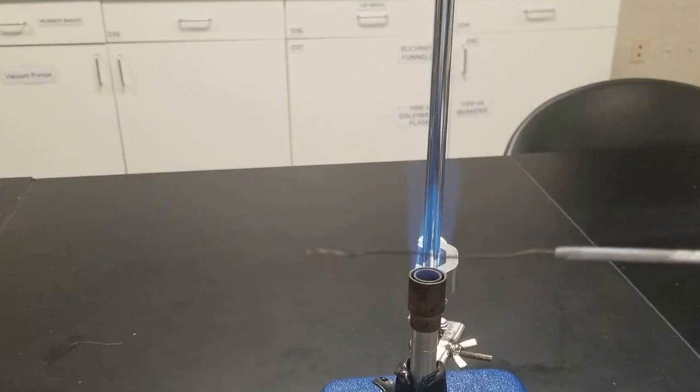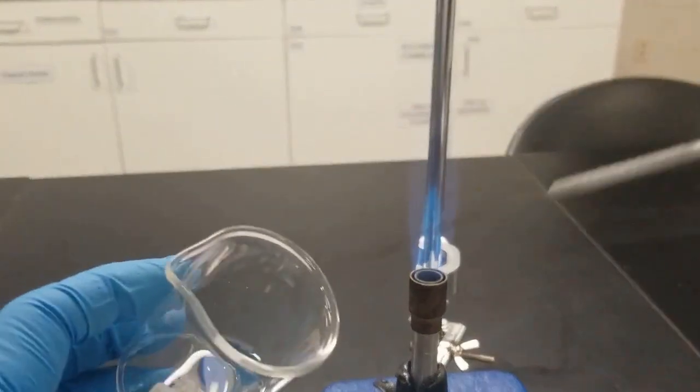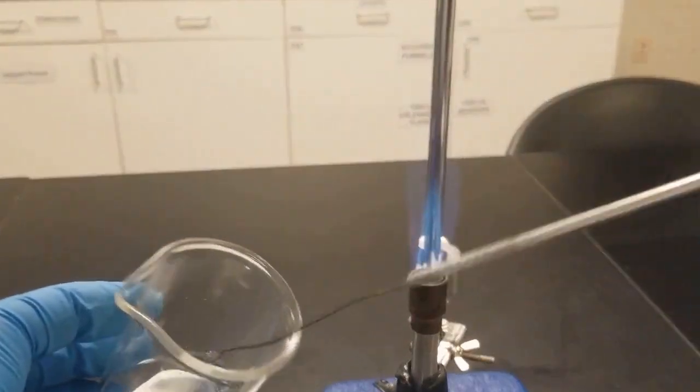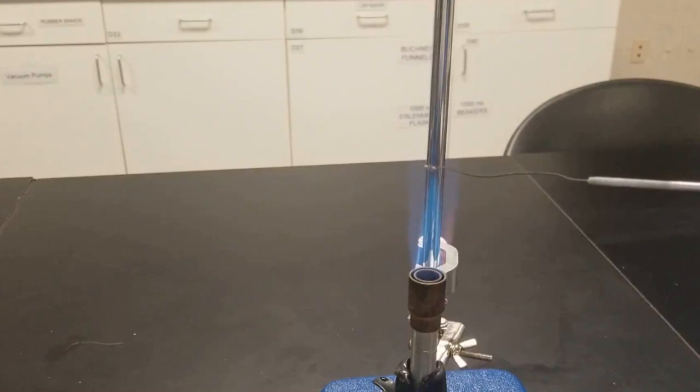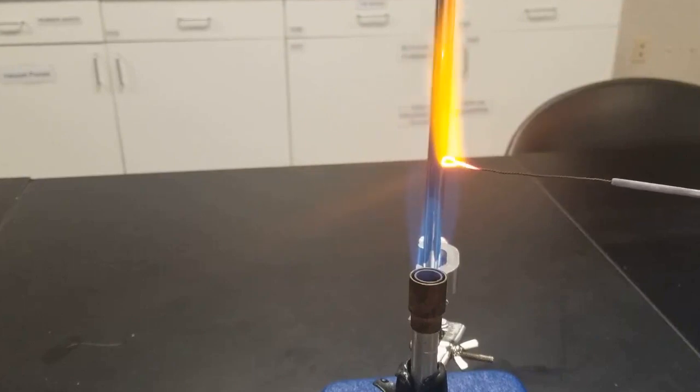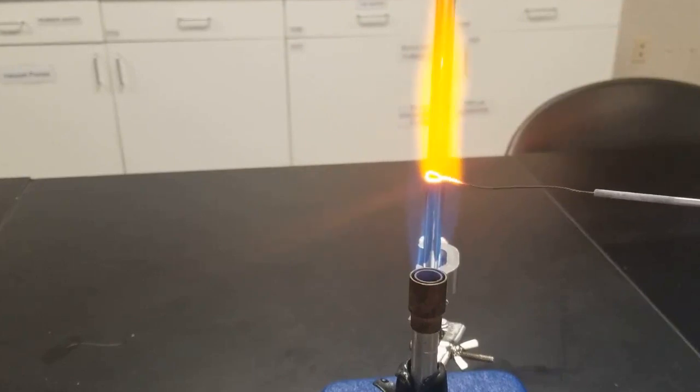Let it cool off, and then the important thing is you really got to wash it in between trials. So again, this is the HCl. Dip it in here. Whoops, you can see I didn't let it cool enough. That's bad. And then let it burn. And you see it's still bright. So off screen, I'm going to repeat this cleaning procedure a number of times until I can go back to that clear, colorless state.